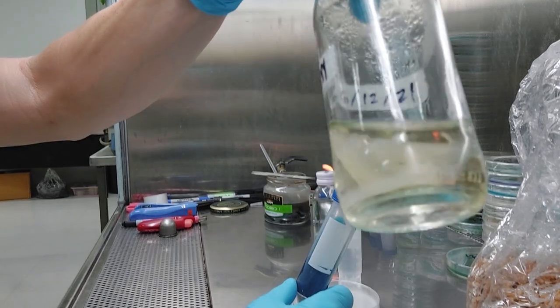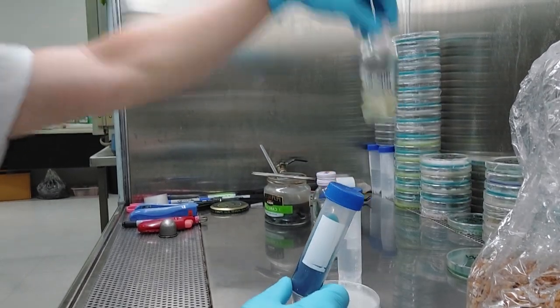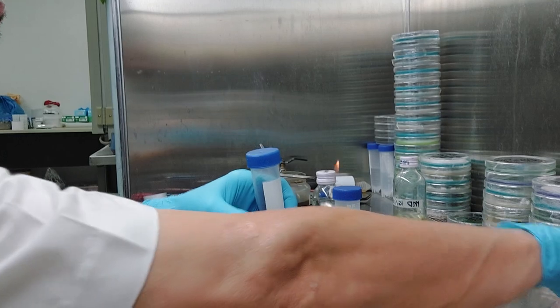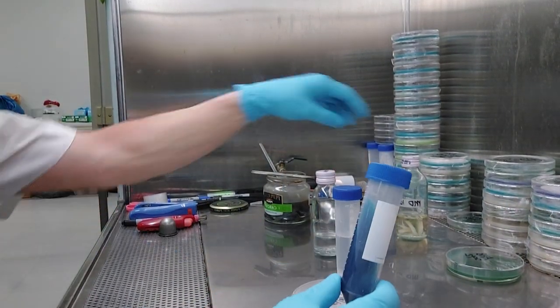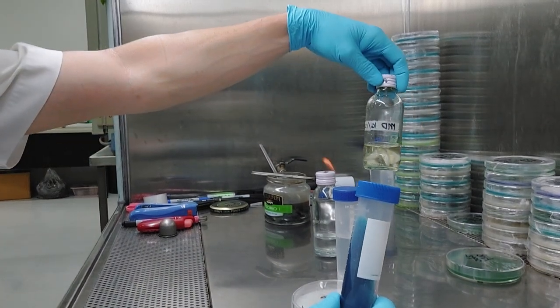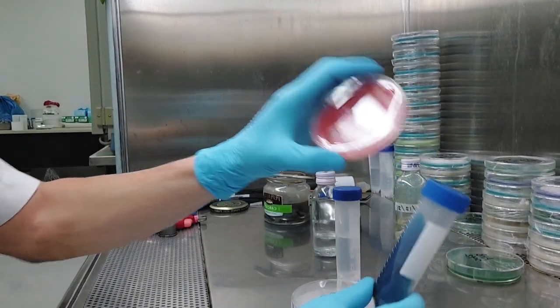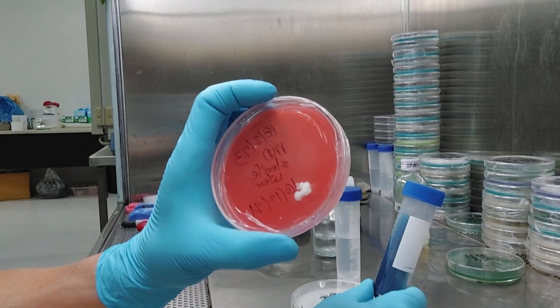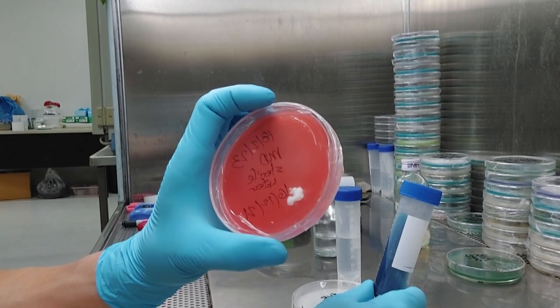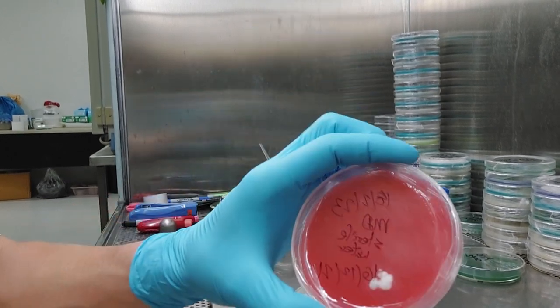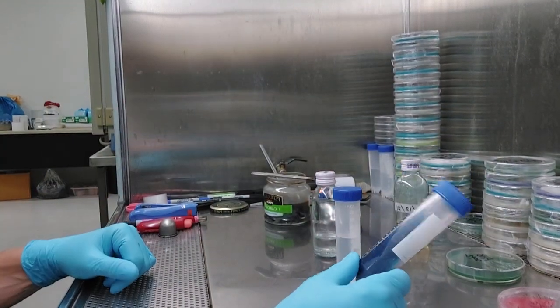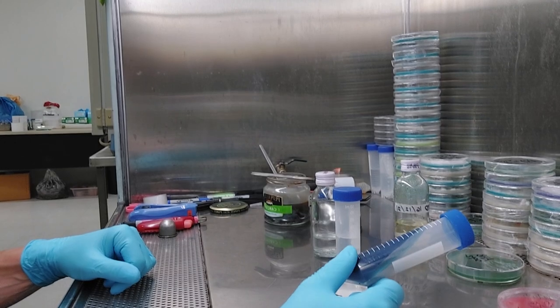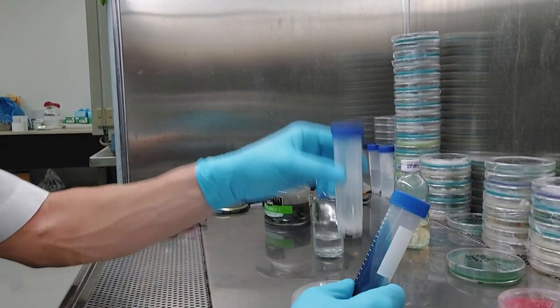You can see those little chunks floating around in there. I pulled one of these chunks out the other day and this was almost two years and three months old. And I pulled out a little chunk there and you can see right there, growing perfectly fine. What do you know? Just like we used to do back in the old lab in the good old days, just like the ATCC does and most other tissue culture collections, they store in water.